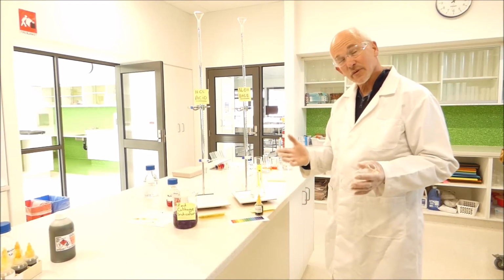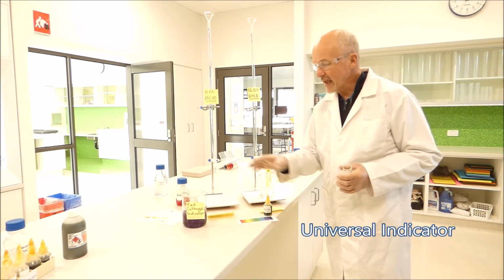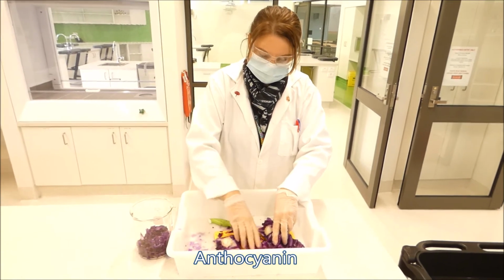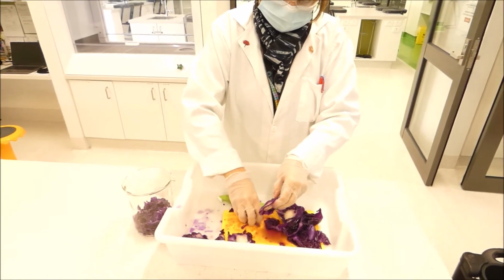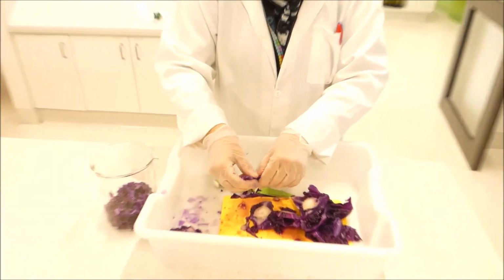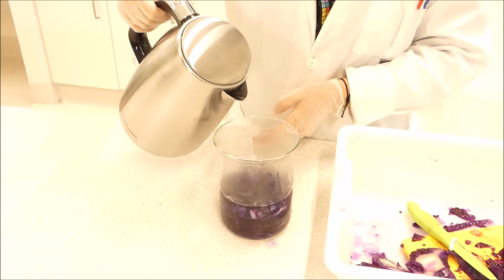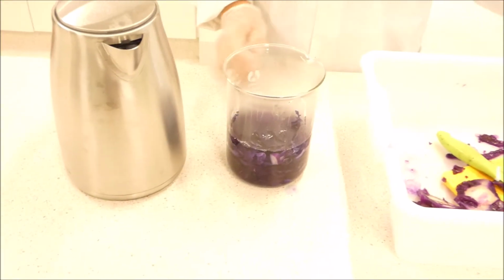Okay, so the next two indicators we're going to test with our burettes here are universal indicator and red cabbage dye indicator. Now red cabbage contains a chemical called anthocyanin, and anthocyanin will change colour to various colours at different pHs. To prepare the indicator, we get a piece of red cabbage, we chop it nice and finely, and we then place it into a beaker, pour boiling water over it until it just covers the cabbage. The hot water will extract the anthocyanins, and once it's cooled we'll be able to then drain off the liquid and use it as our acid-base indicator.